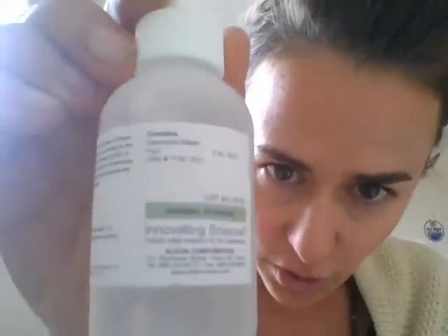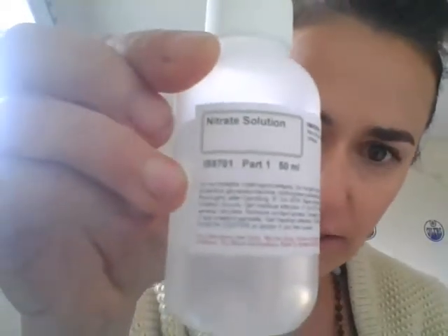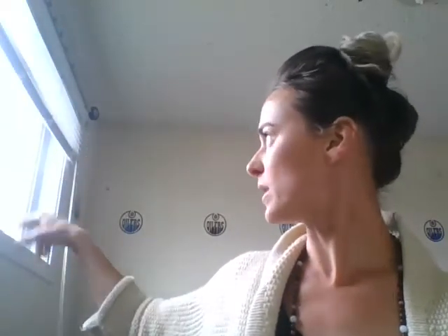So what I did is, into each of the three different types of samples, I added 10 drops of the control. So the reason why we add pure water as our control, your control group is normally pure water, is because we want to prove that by adding 10 drops of something from this bottle isn't what caused the change. So I added 10 drops of the control into the filtered water control, the rainwater control, and the tap water control.